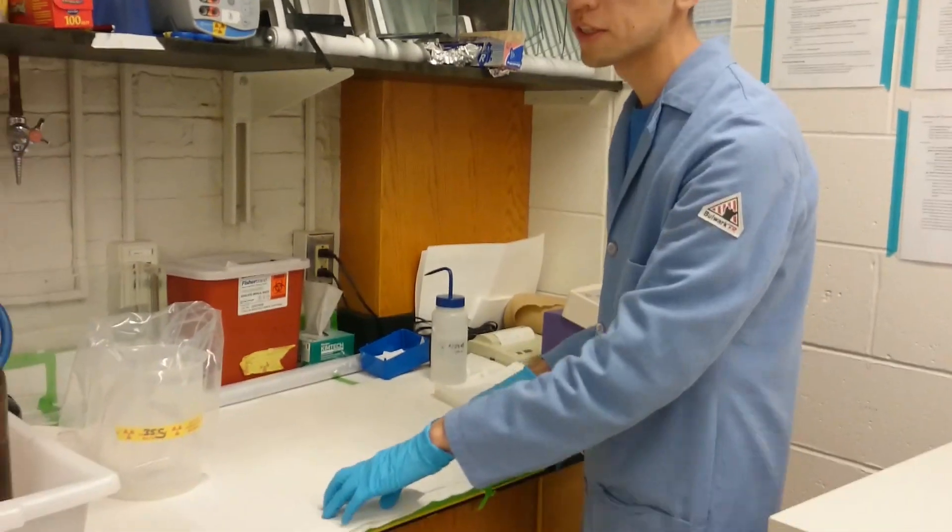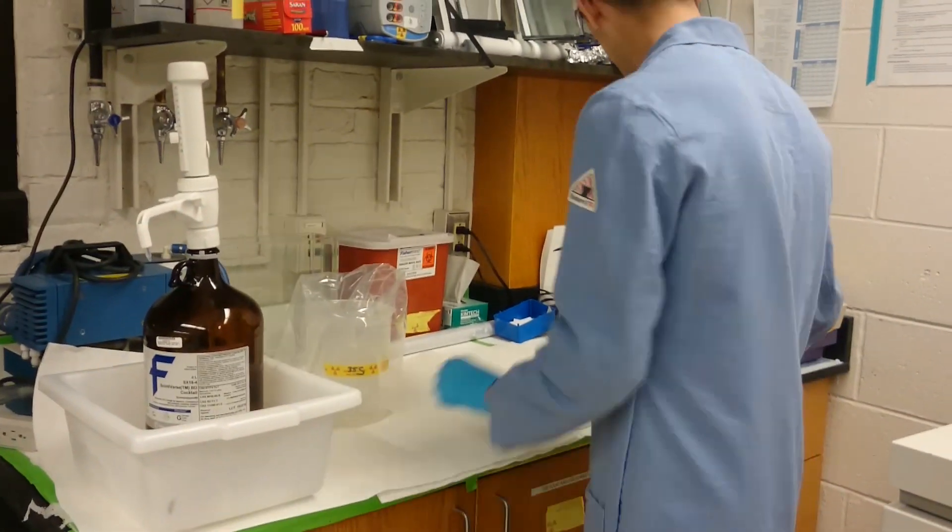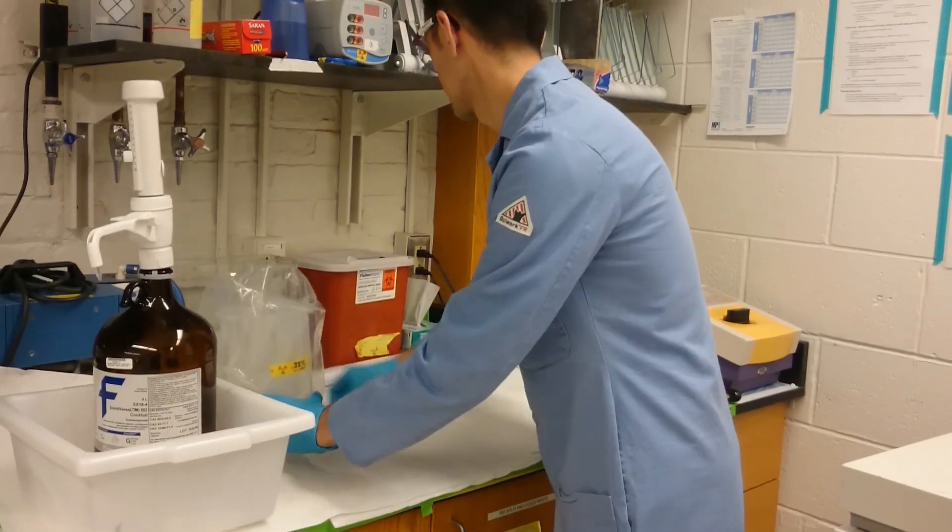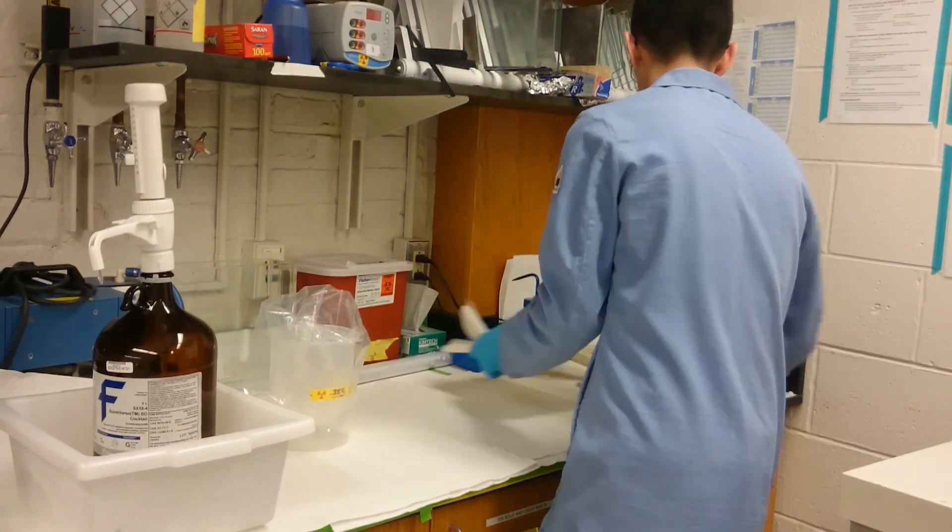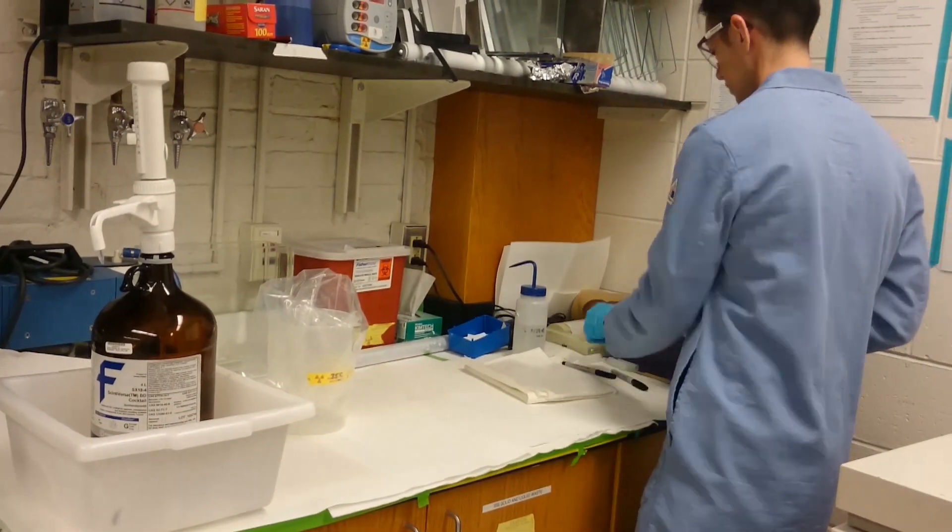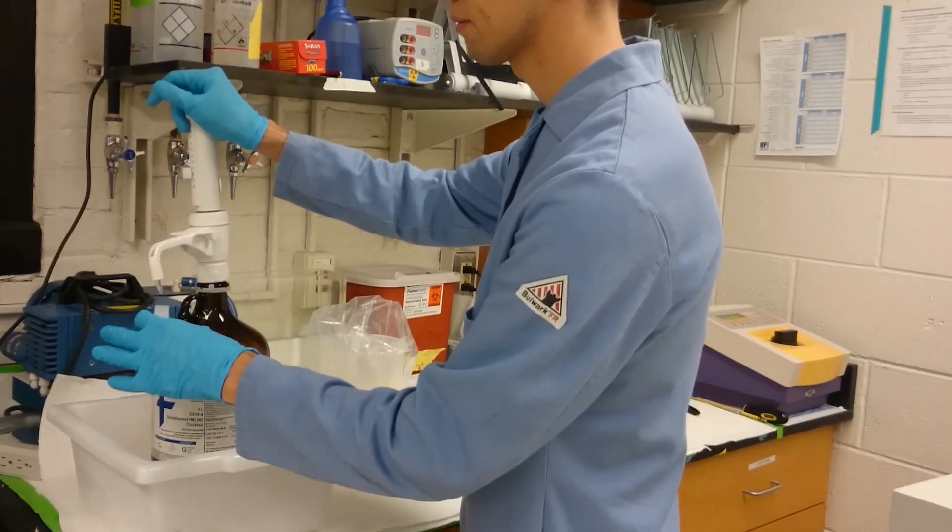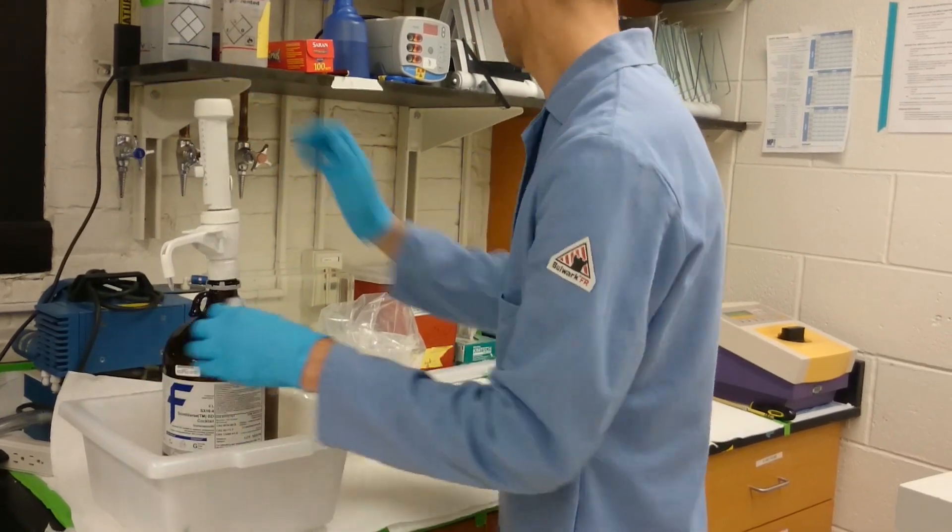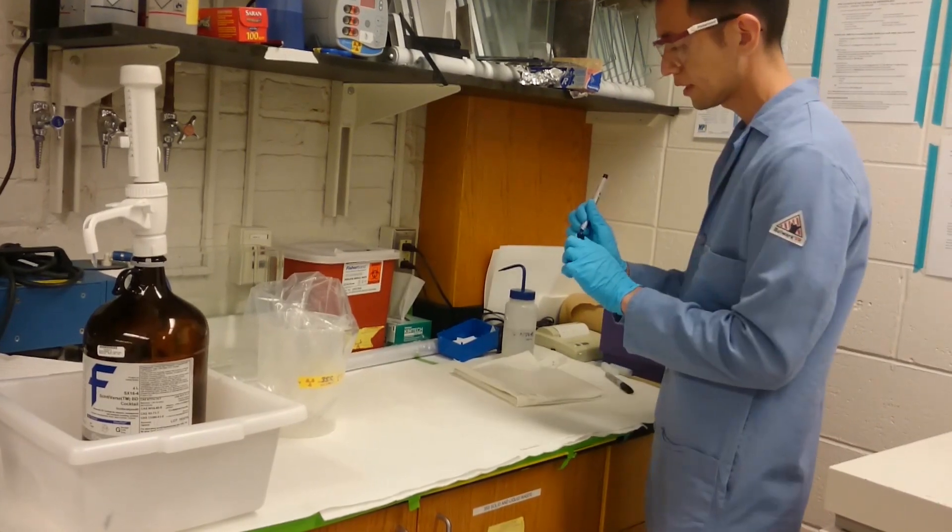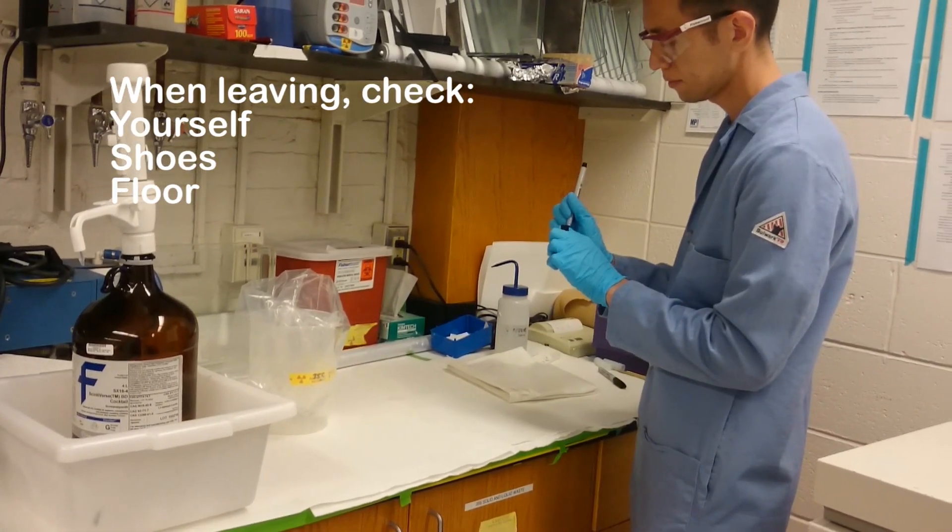And then the other thing that you have to check is the bench itself.